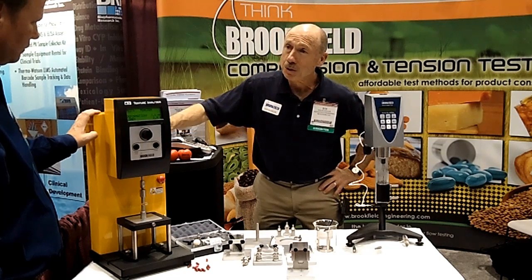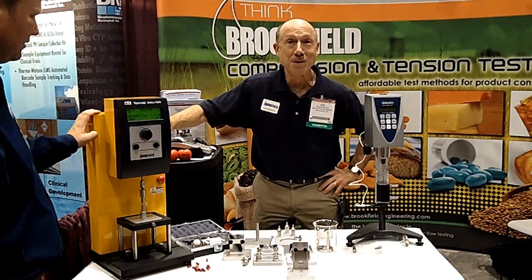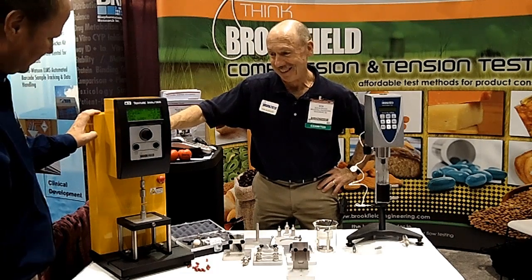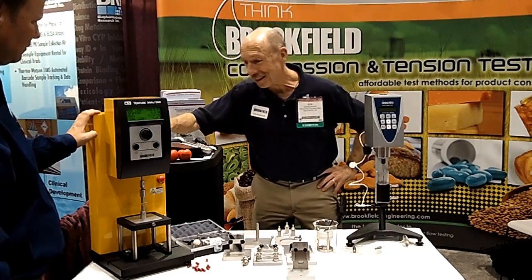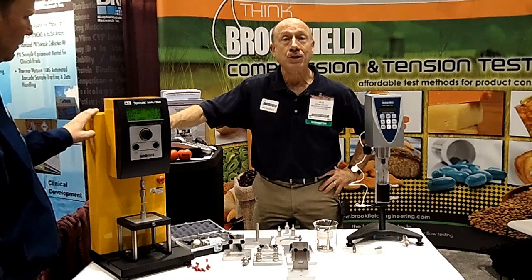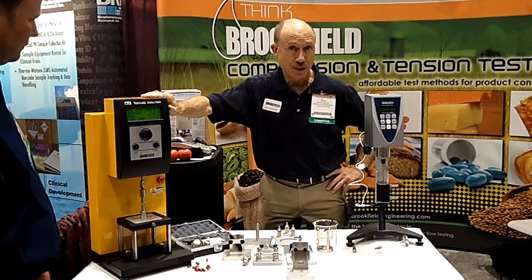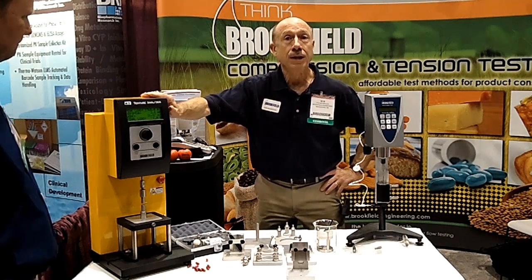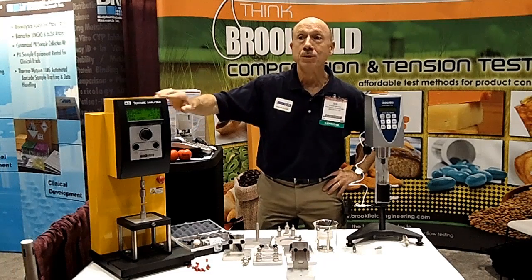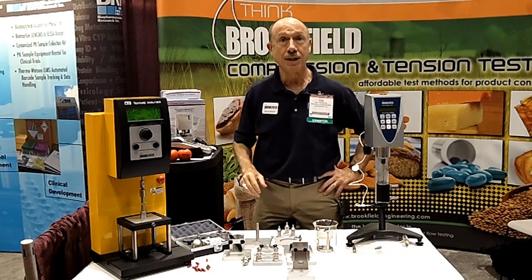Is our test concluded now? One more millimeter. And that's it — it physically fell apart because it split in two. That concludes the test for the capsule loop tensile fixture, and it gives us a fair measurement of the actual stress that the capsule can withstand.